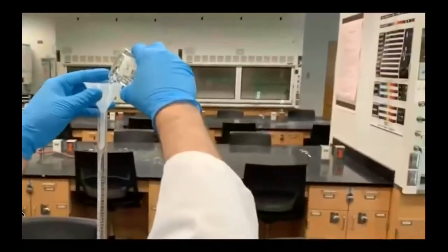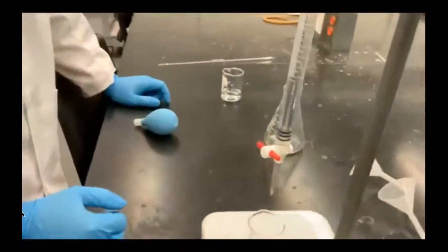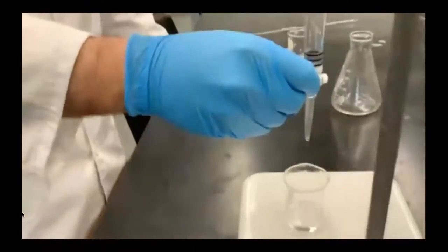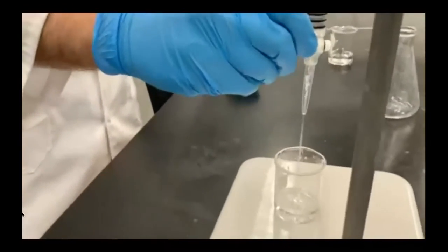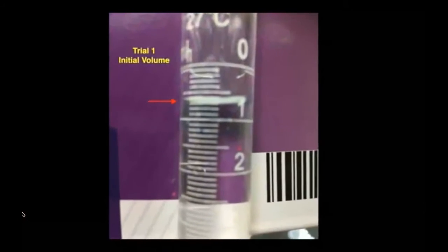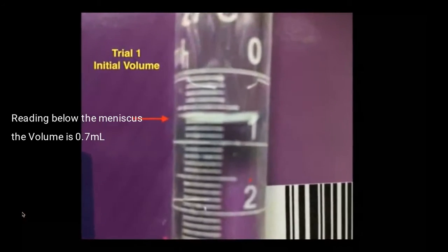Then we repeat that process with our standard, the 0.1113 moles per liter sodium hydroxide. We're going to open the stopcock to allow some of the air to run out and record the initial volume.